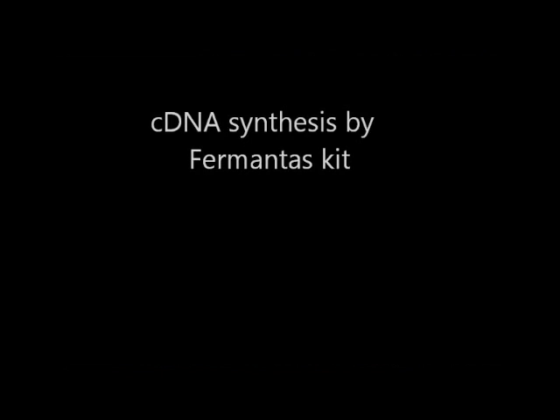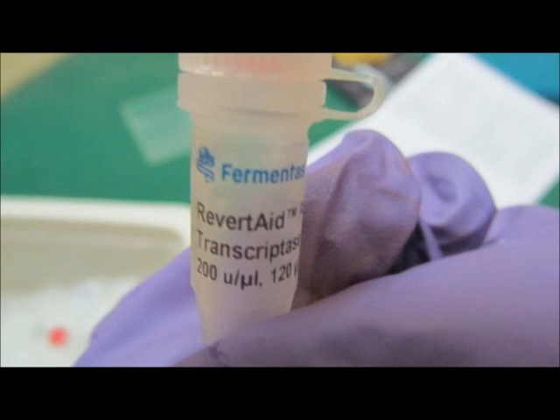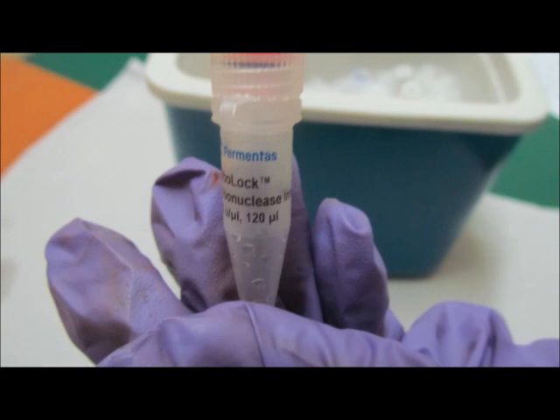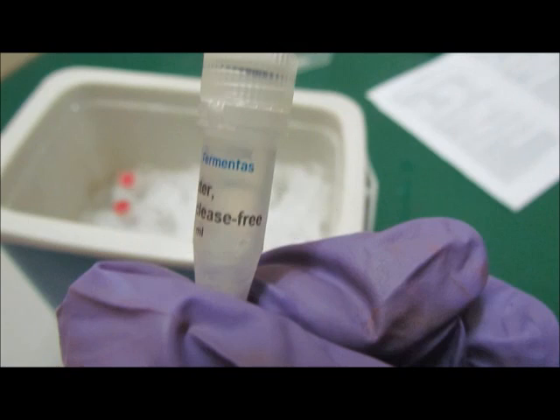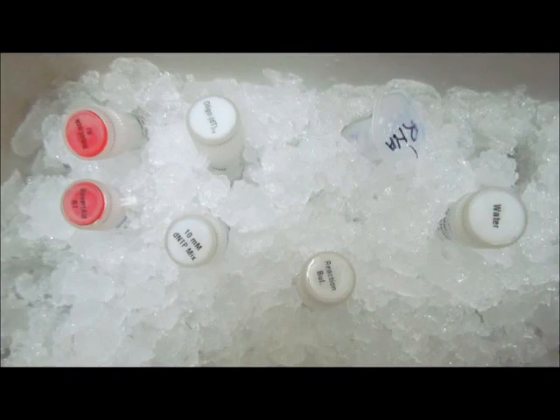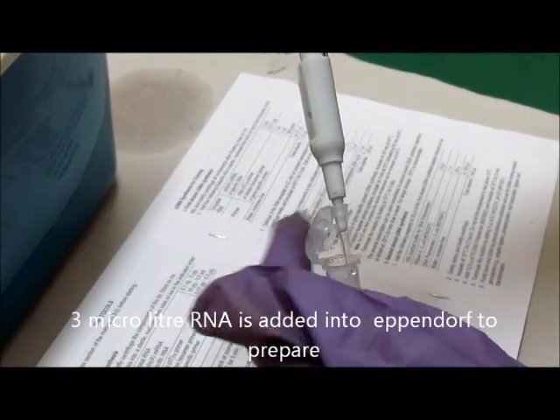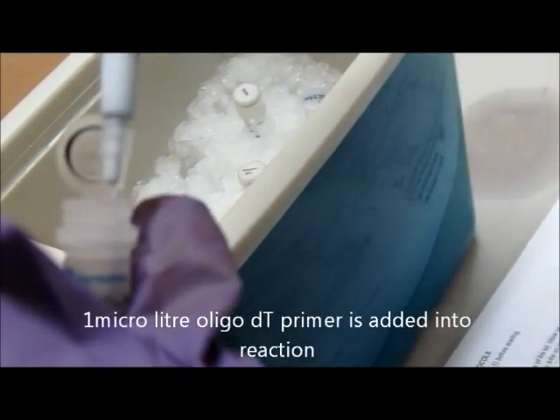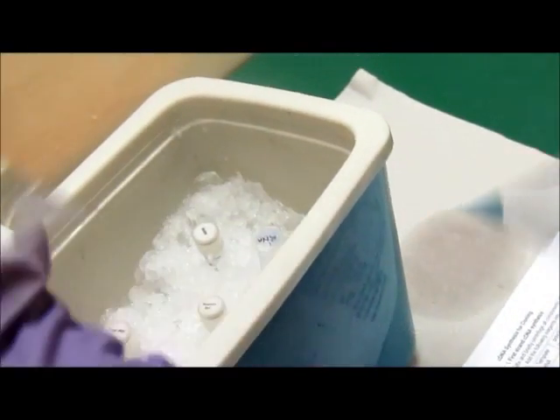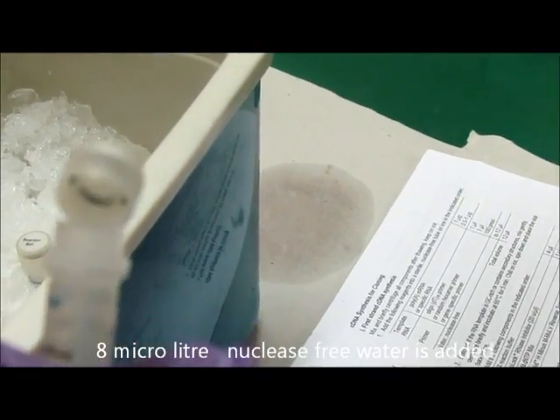cDNA synthesis using the Fermentas kit. The materials required are reverse transcriptase, ribonuclease inhibitor, dNTP mix, reaction buffer, nuclease-free water, and RNA. In the first step, add 3 µl of RNA into a PCR tube to prepare the reaction mixture. Then add 1 µl of oligo-dT primer and 8 µl of nuclease-free water and mix well.